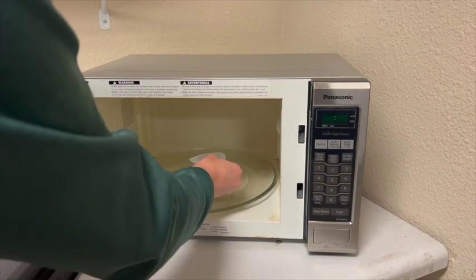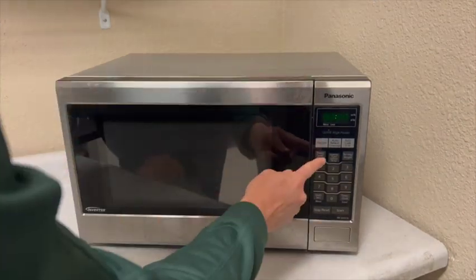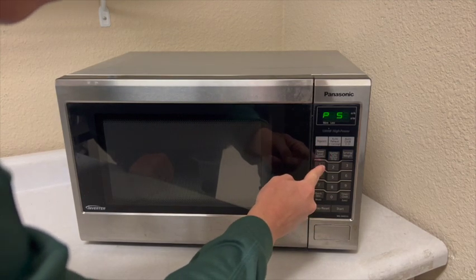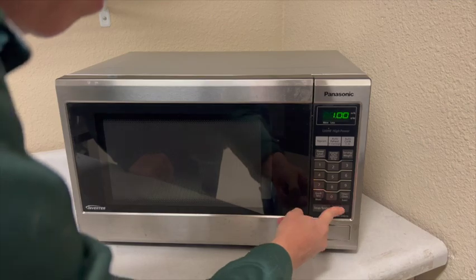This time will depend on your actual microwave, but the object is to get the wine sample down to about 7 or 8 ml using a gentle boil without having any wine splash out of the beaker.